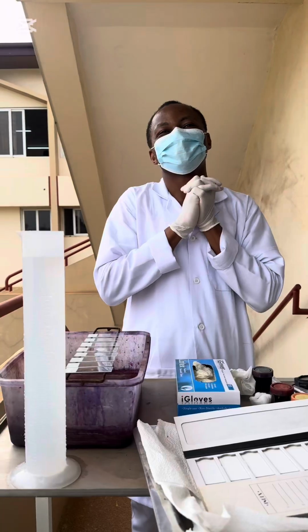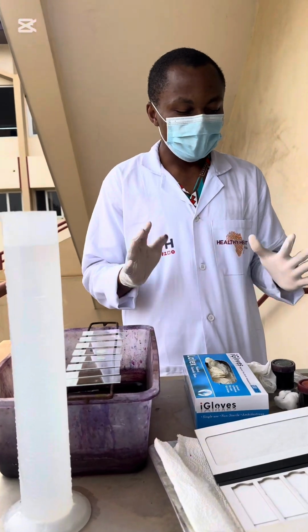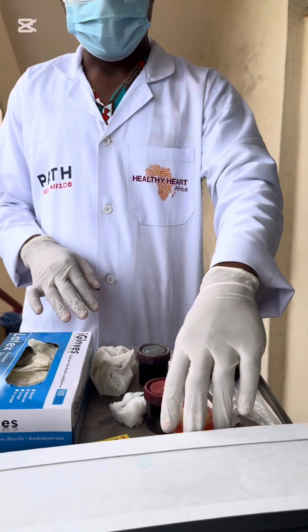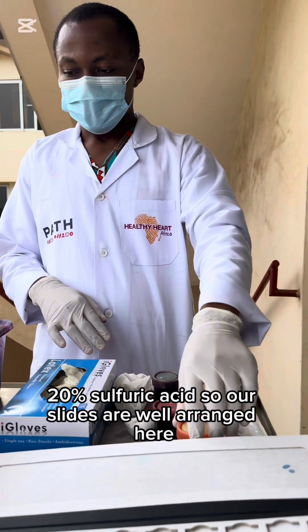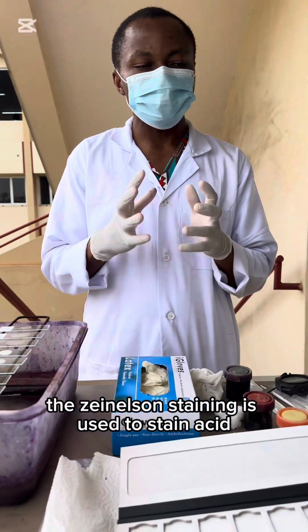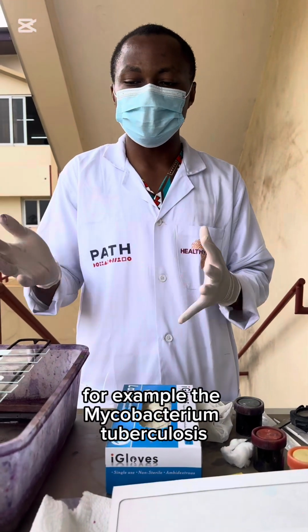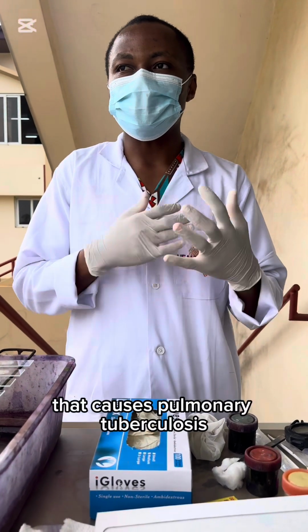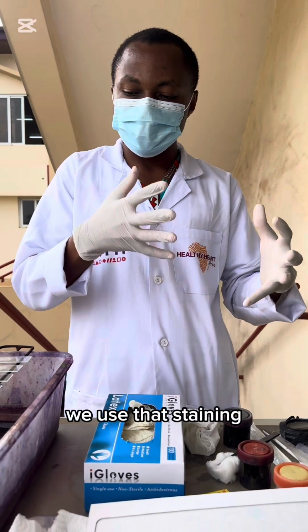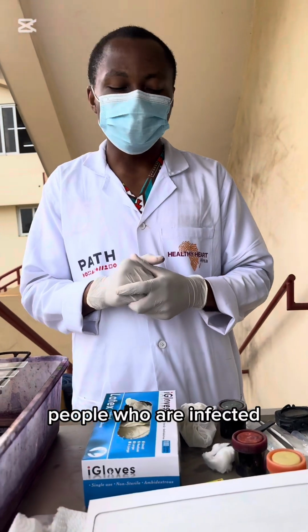Hi everyone. So we are outside here to perform our Ziehl-Neelsen stain. These are the things we need: your carbol fuchsin, your methylene blue, and your decolorizer, 20% sulfuric acid. So our slides are well arranged here. For the purpose of knowledge, the Ziehl-Neelsen staining is used to stain acid-fast bacilli, for example Mycobacterium tuberculosis, that causes pulmonary tuberculosis and other extrapulmonary tuberculosis. We use that staining technique to detect this organism in the sputum of people who are infected.